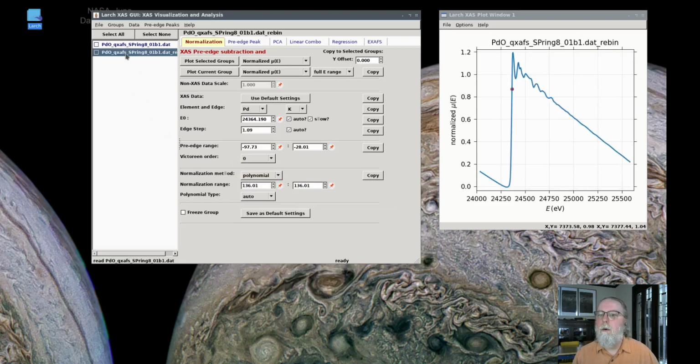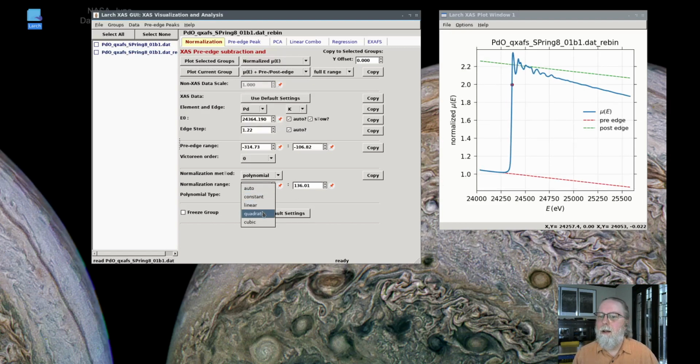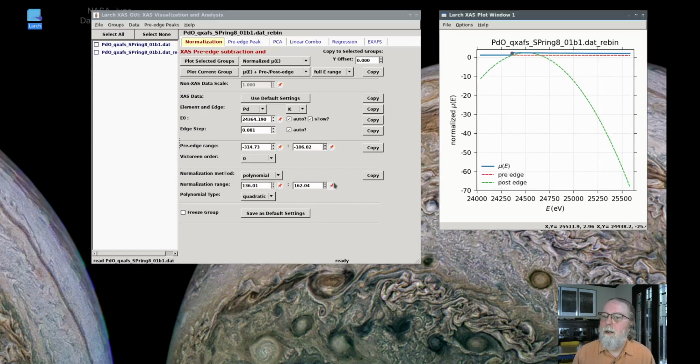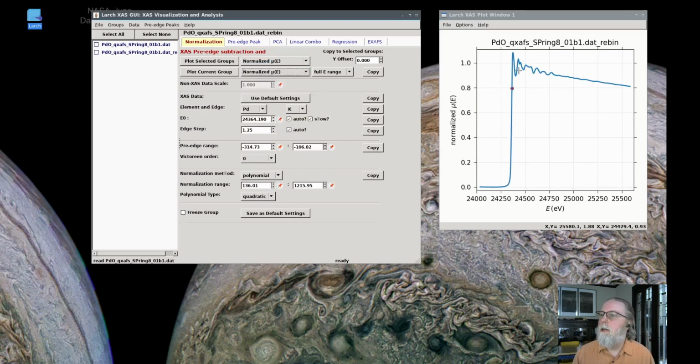It turned out that the pre-edge ranges were not very appropriate, so we're going to select those again and plot that normalized XAFS data. In fact, I'll show again, to do a better job at the edge step normalization. And look, the polynomial range was incorrect here, so we will make sure that we've selected that well so that it does a better job of normalizing that XAFS data. In fact, maybe if I make that auto, I think it'll set it back to quadratic. And that looks appropriate. And now if I show that as normalized XAFS data, that looks pretty good.